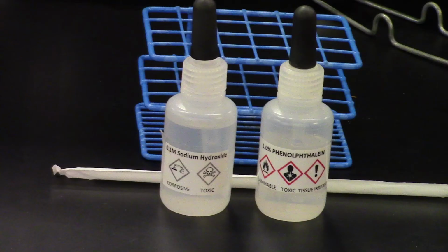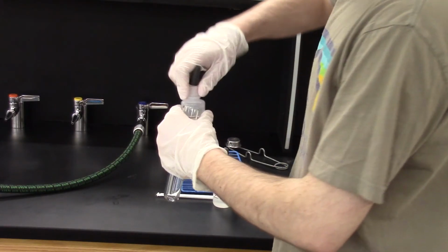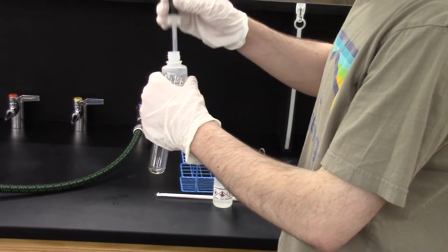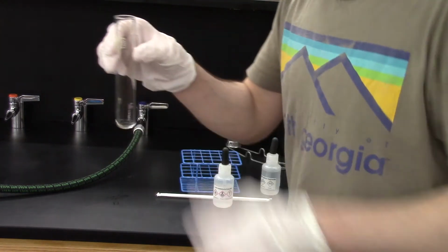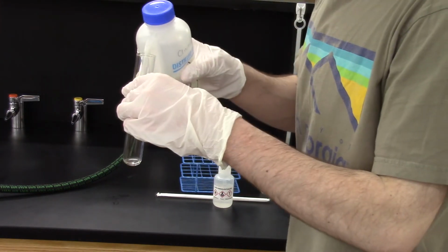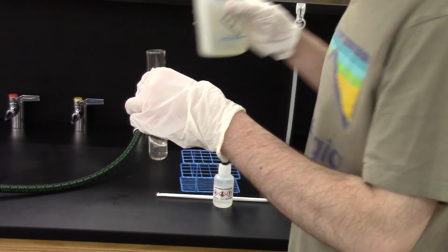Part F is the last experiment we need to go over together. For this, we're going to need some aqueous sodium hydroxide and a few drops of phenolphthalein. Phenolphthalein is an indicator, which means it changes colors depending on its chemical environment. It's not part of the reaction we're going to see, it just tells us whether the solution is basic or not. In a large test tube, I add some sodium hydroxide solution and some distilled water. The water is just to increase the volume to make a later step work better.